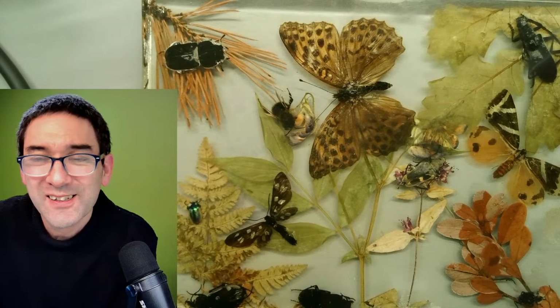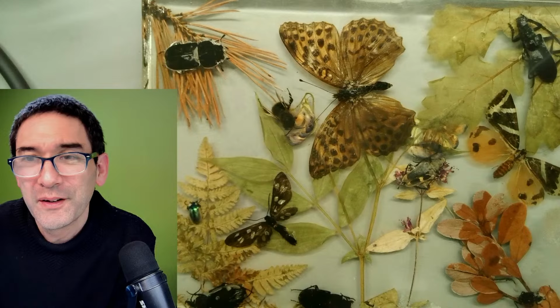So let me have a look at some of the other questions and comments that we have here. In the meantime, I'm looking at something else, because an empty table looks a little bit boring. Okay, so I'm going to quickly look at some of the comments here.